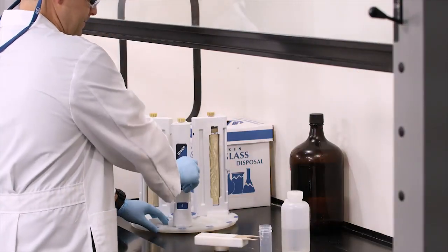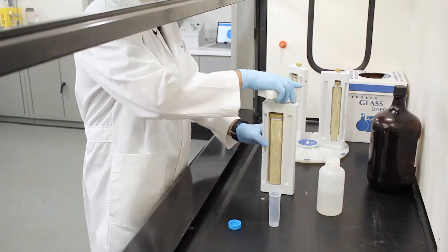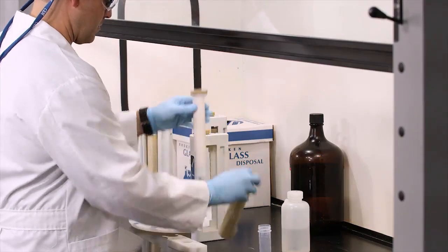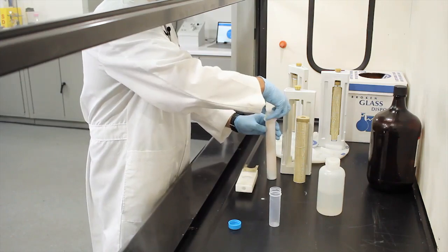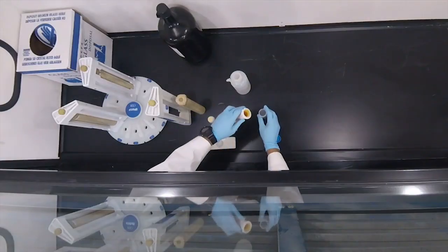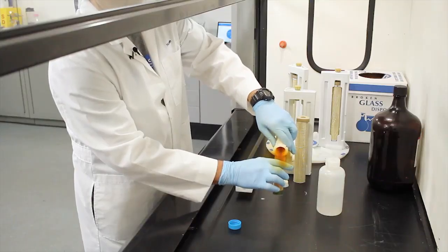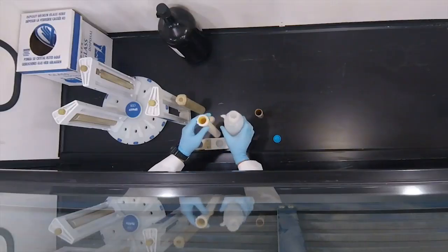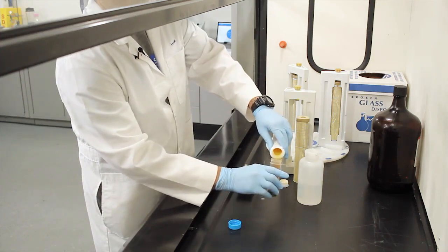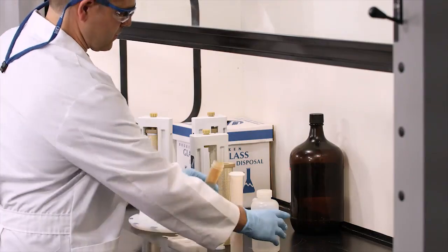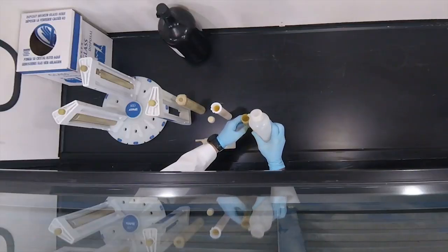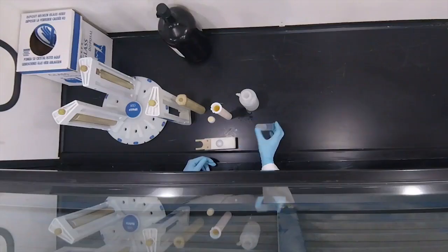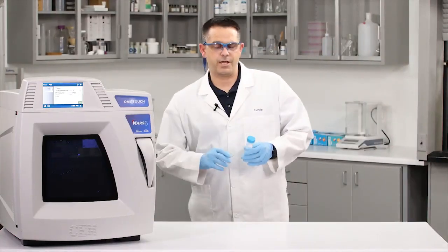Now that our samples are cool, let's go ahead and vent these off in the hood. And now we're going to do our dilution.